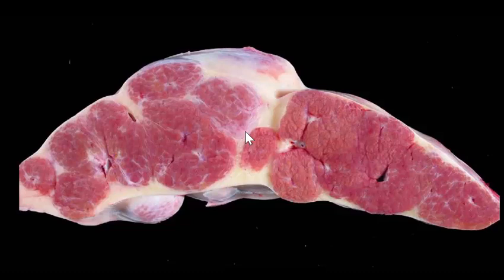Okay, so a morphologic diagnosis for this will be diffuse hepatocellular necrosis and loss with post-necrotic scarring. And you can probably go a number of different ways as long as within your morphologic diagnosis you talk about the necrosis of the hepatocytes, the loss of hepatocytes, and some form of fibrosis. Okay, and then what I would do is at the end, just to make sure that everybody knows that I know what I'm talking about, I'm going to put cirrhosis in parentheses.